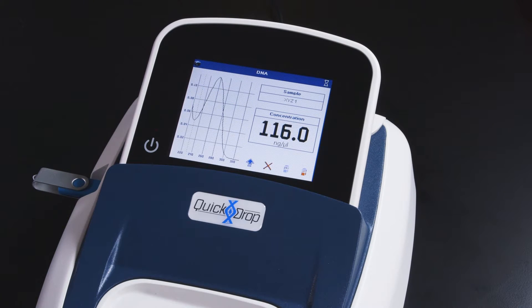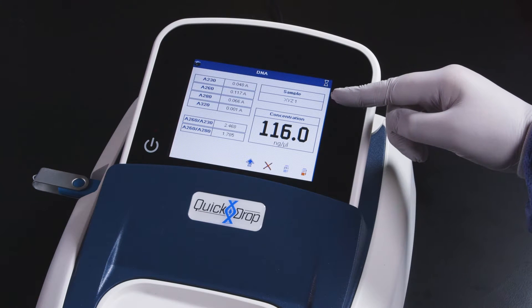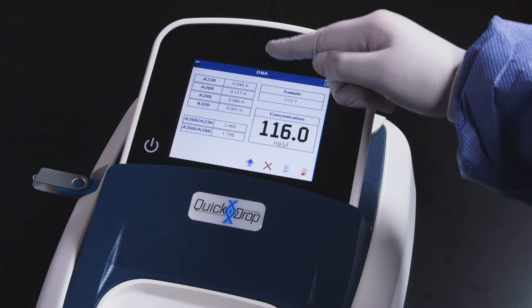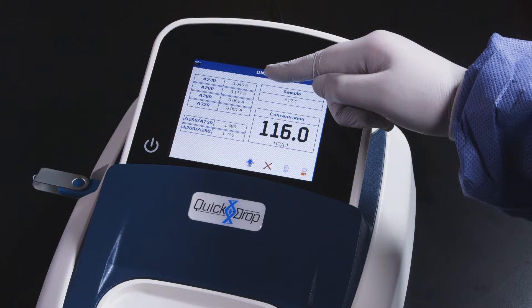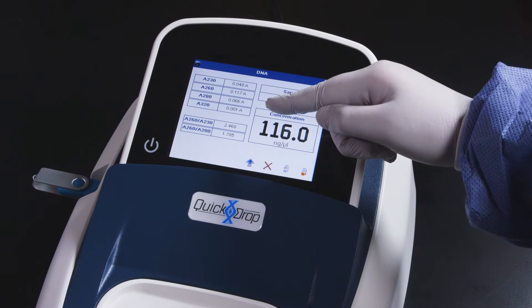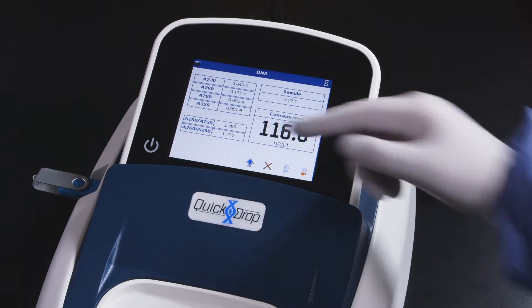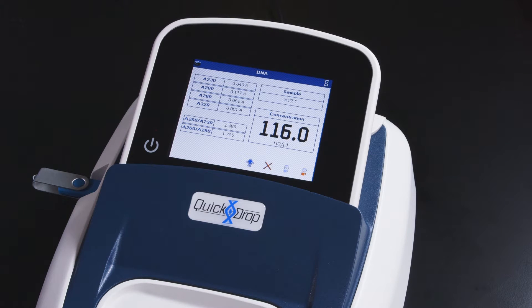Here we have the results displayed in the sample window, including the calculated DNA concentration and absorbance values at A230, A260, A280, and A320.